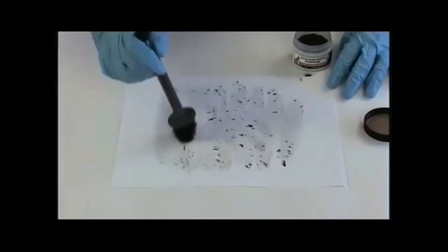The powder gets in very deep, and it's an easier way to develop the print.